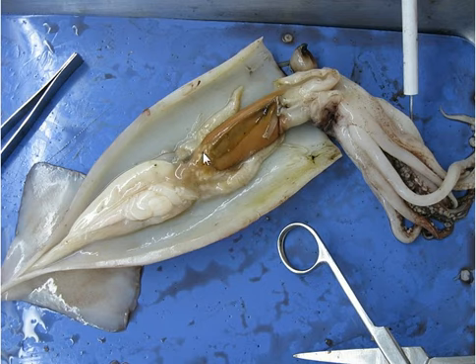I already took out the ink sack, but it was here and it was black with yellow. It was really cool because I got to write with it on my paper. This is the beak that I already took out. These are the arms — the short ones — and that's the sucker disc.